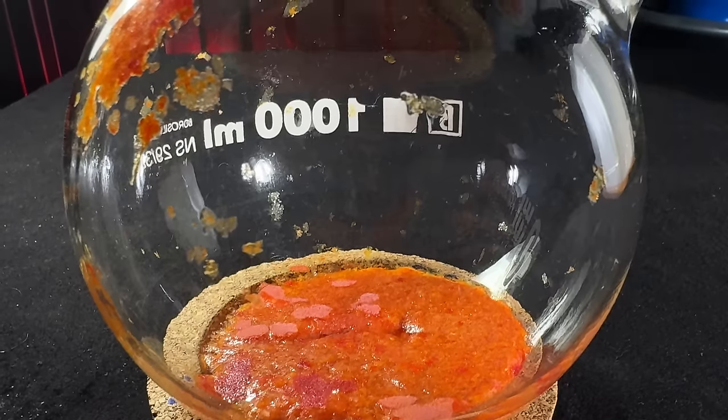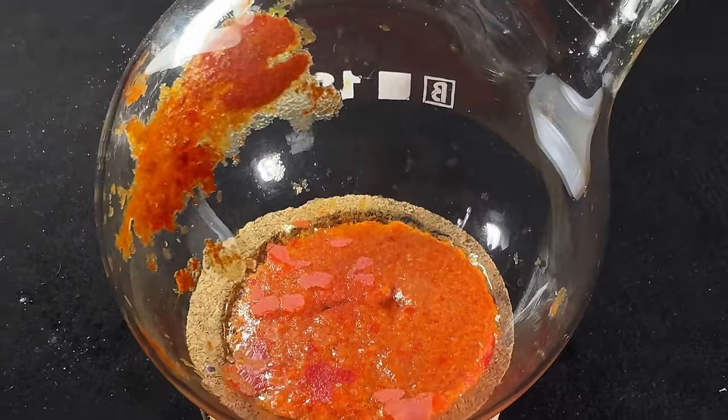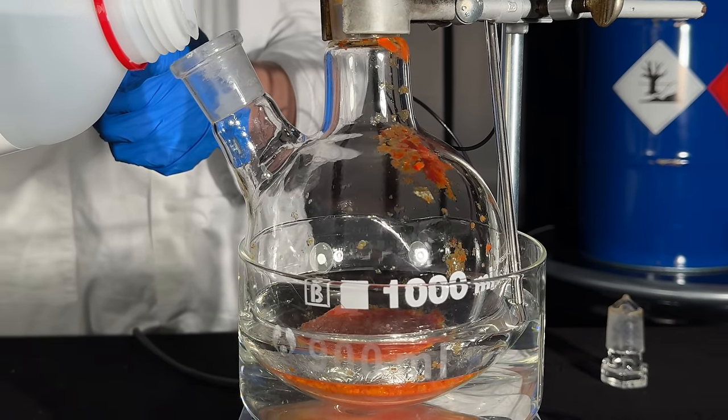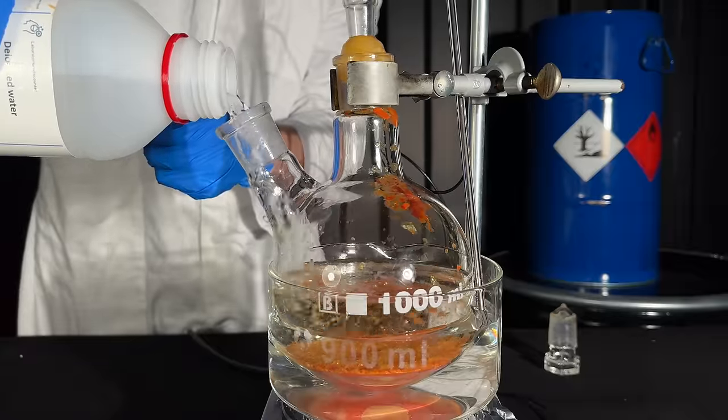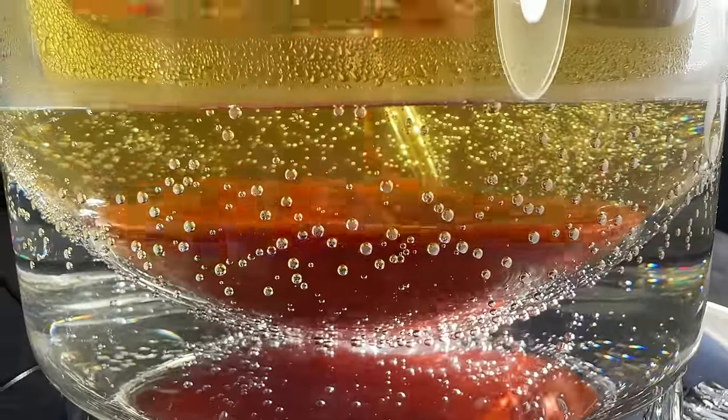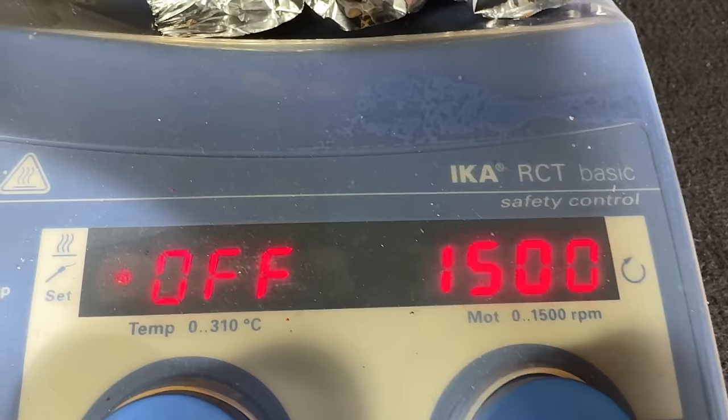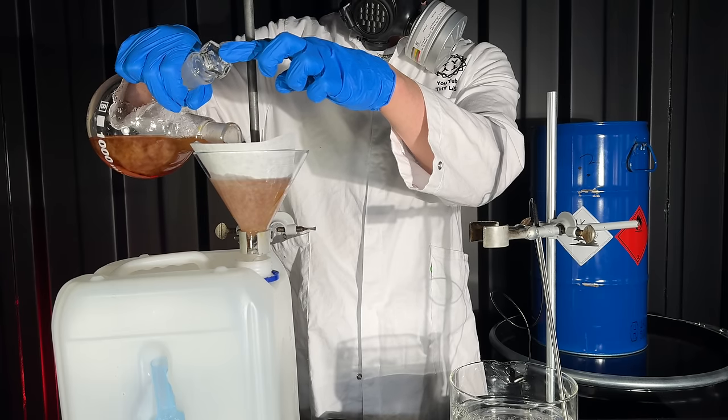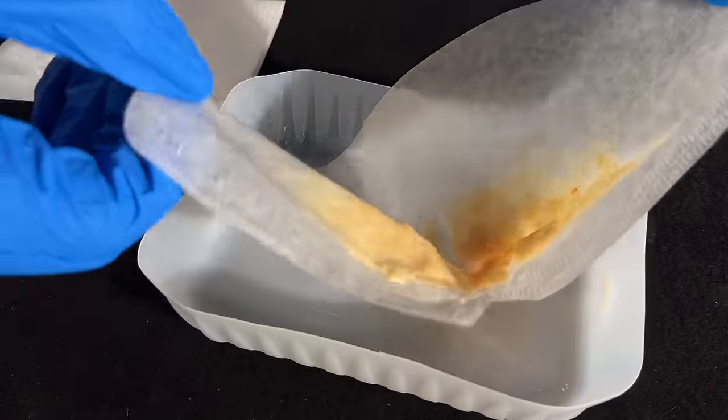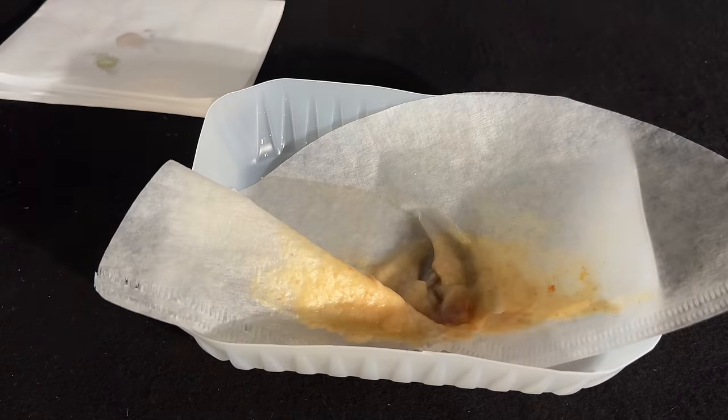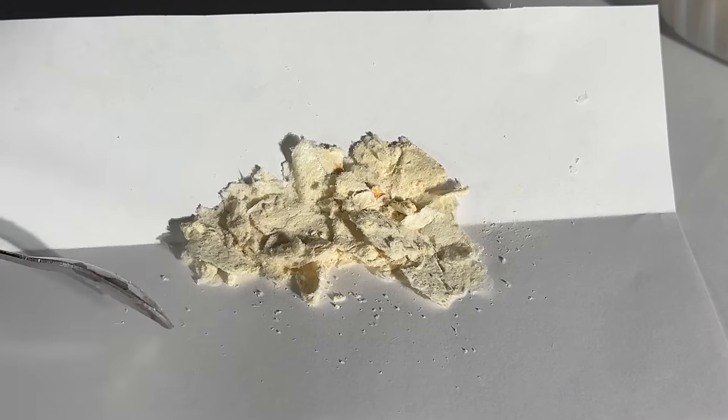Despite the intense orange color, trichlorophenol is poorly soluble in water and we mainly got hydrochloric acid. For this reason I just got rid of that nasty orange water. To purify TCP I need to recrystallize it. I ended up using water as there is leftover hydrochloric acid. As it cooled down, crystals crashed out. The product is not as orange as before and this is a good sign. I got 0.7g of very fluffy and slightly yellow product. For the massive chunk which was left over I decided to use a mixture of ethanol and water to increase the solubility.